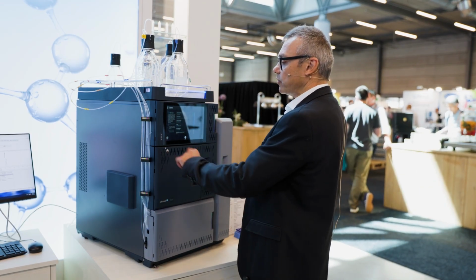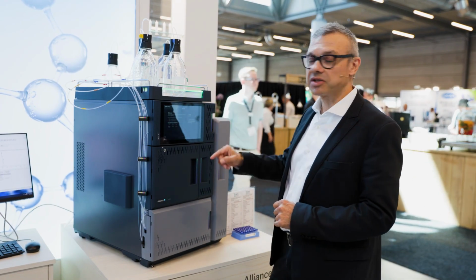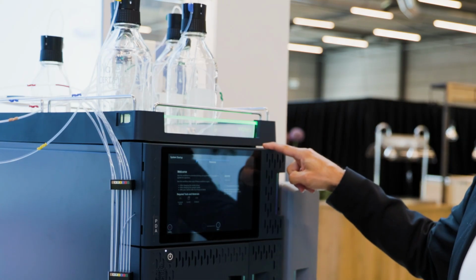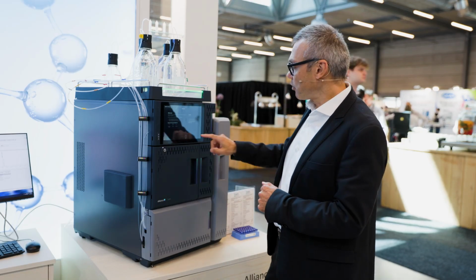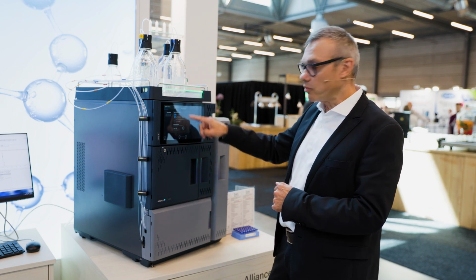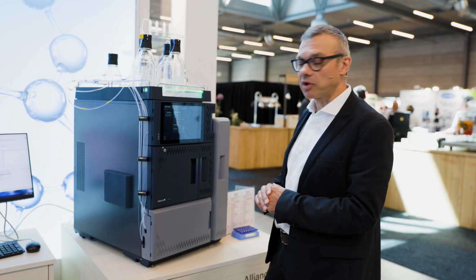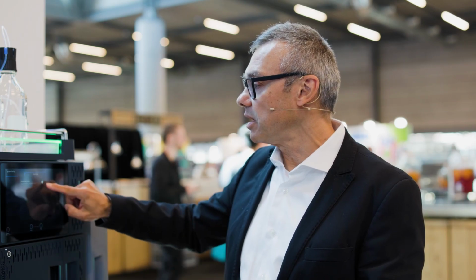And next, I would start a guided sequence to start the system. Now the system blinks green, telling me that the system is going to be properly primed, so all the lines will be primed with the due amount of solvent, and then I will go to the next step until all my process is done automatically, and I will not forget to prime my seal wash line, for example, so I will prevent errors from happening.